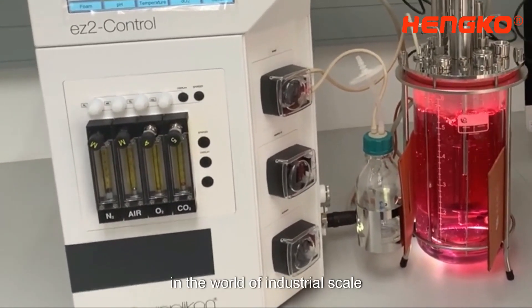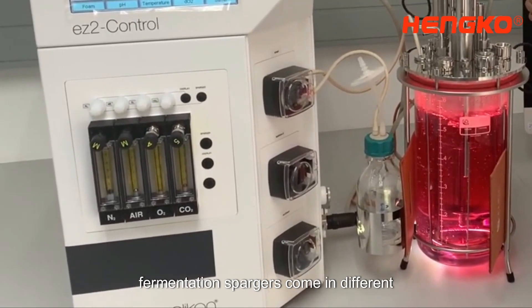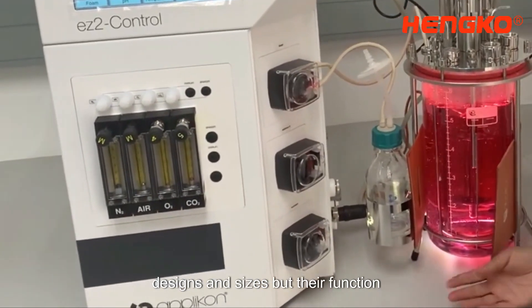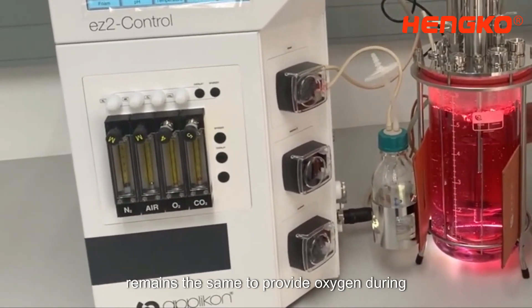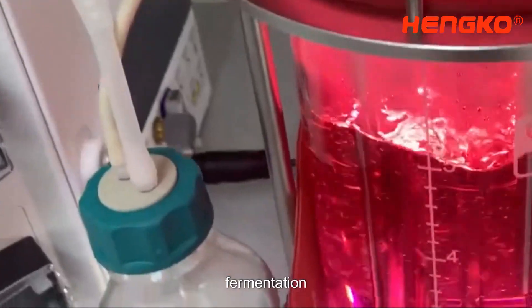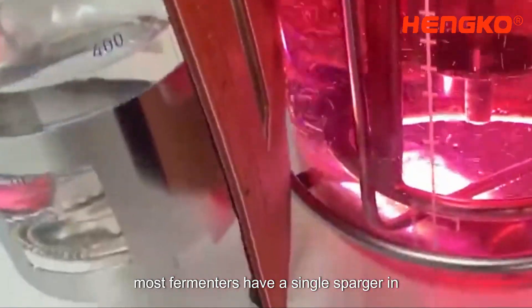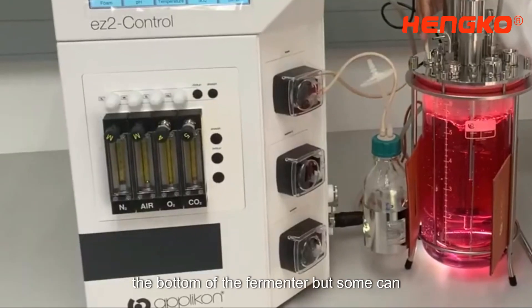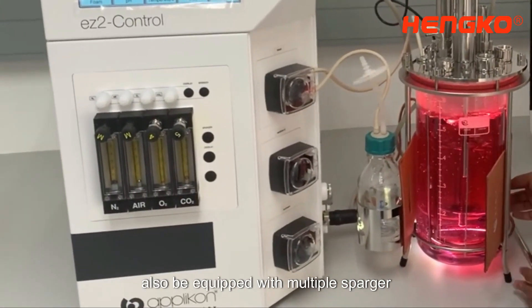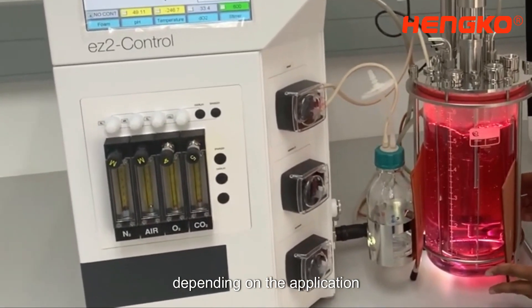In the world of industrial scale fermentation, spargers come in different designs and sizes, but their function remains the same: to provide oxygen during fermentation. Most fermenters have a single sparger at the bottom, but some can also be equipped with multiple spargers depending on the application.